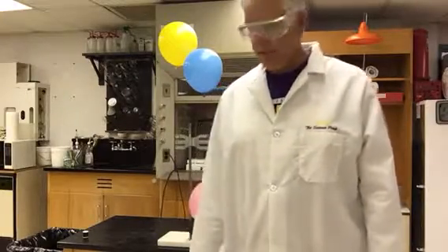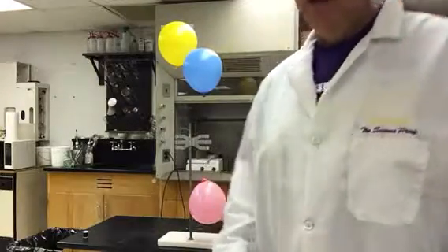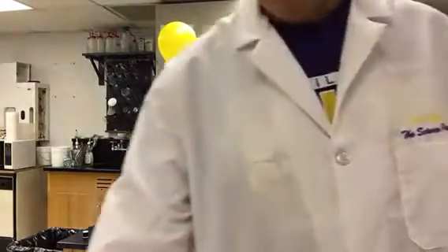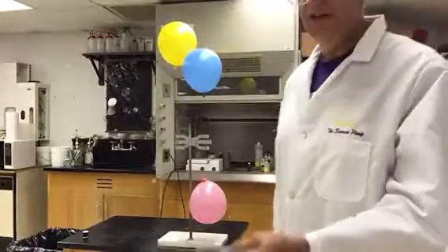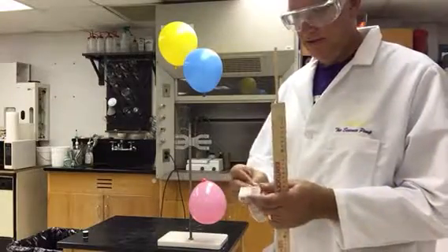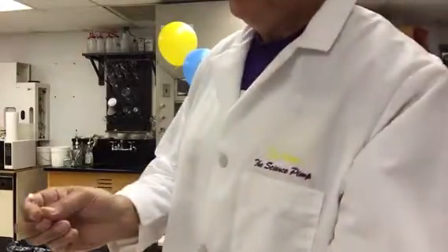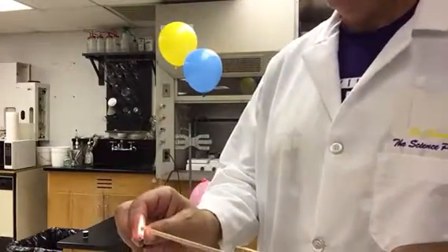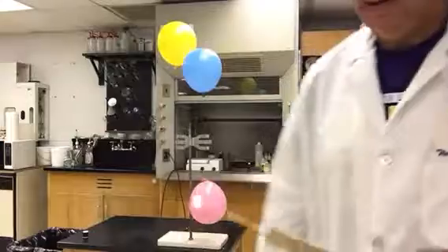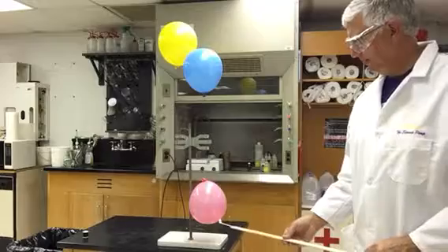So to demonstrate that, I want to try to react them with oxygen. I also have a pink balloon here, which is filled with air, so that's going to be our control. And what I'm going to do is try to use a little bit of activation energy in the form of a flame, and I want to see if I can react these substances with oxygen in the air and set them on fire. One of the chemical properties of a substance is its flammability. So I'm going to take that fire and now pop the pink balloon with it. Let's watch and listen.